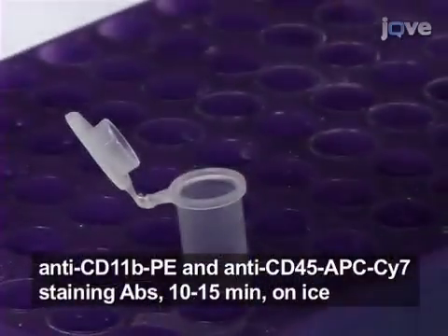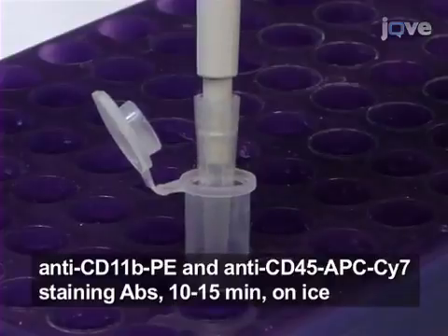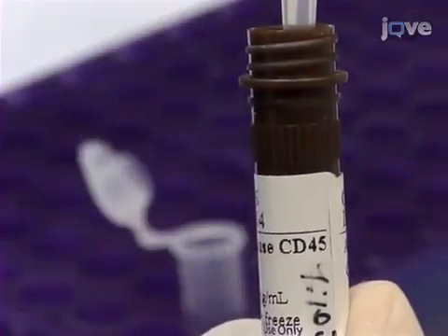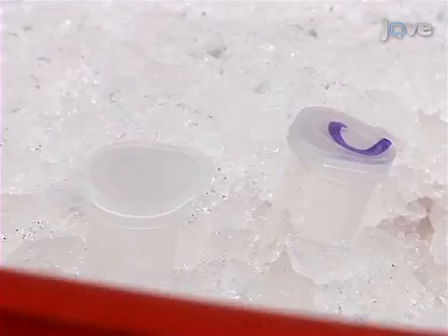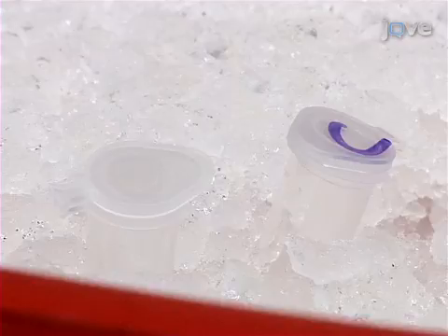To one tube, add 1 microliter of anti-CD11b and 2 microliters of anti-CD45 antibodies, incubating the cells for 10 to 15 more minutes on ice. Label the second tube negative control and place it on ice.